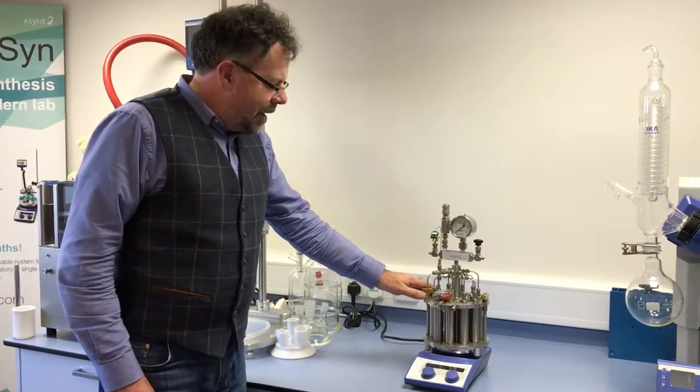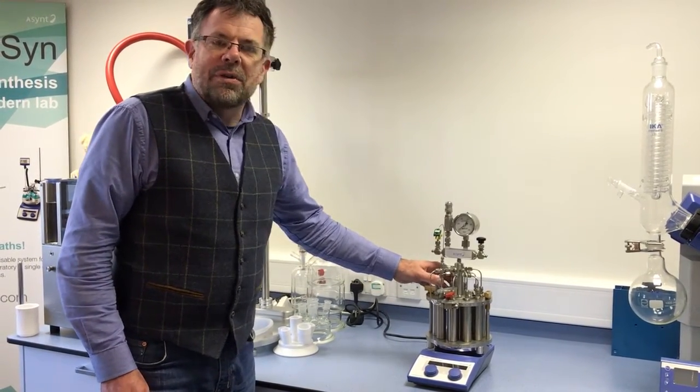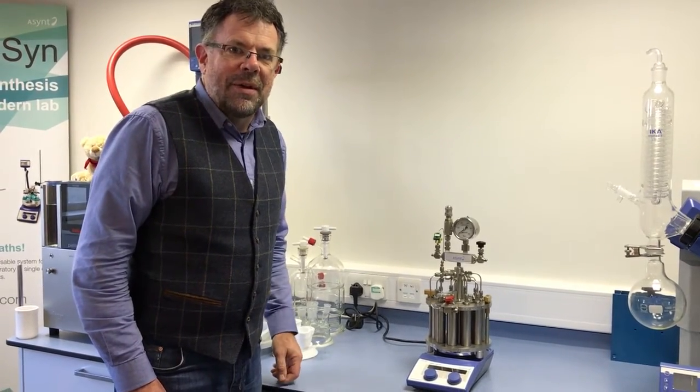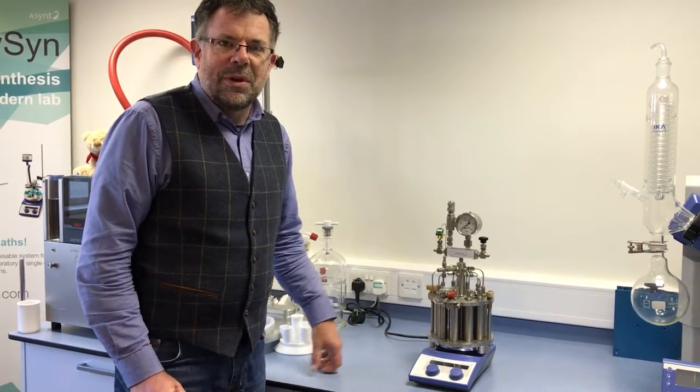This is the Asynt Multicell, 10 parallel reactions and pressures up to 50 bar standard and 200 degrees centigrade. I'm just going to show you now how to dismantle and assemble the unit and what are the features you need to know when using it.